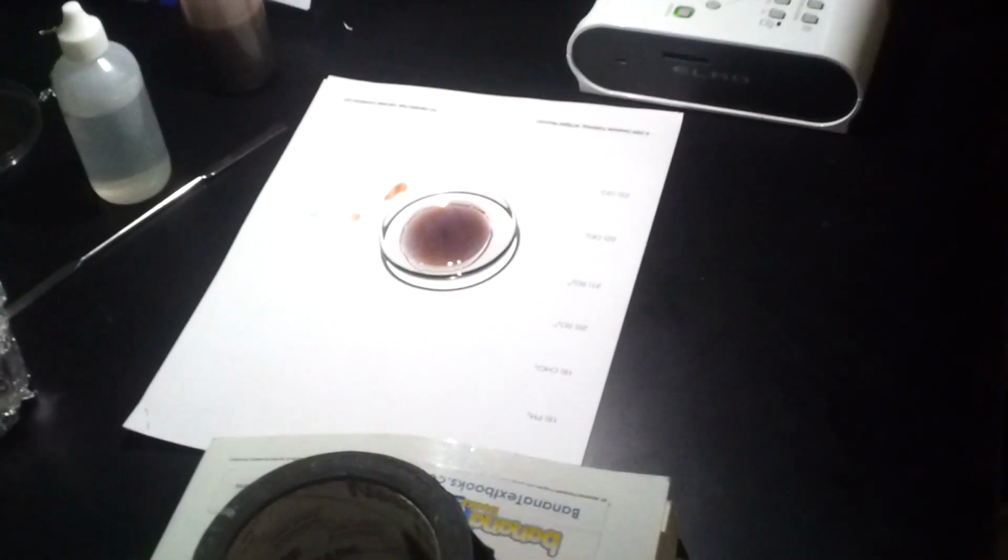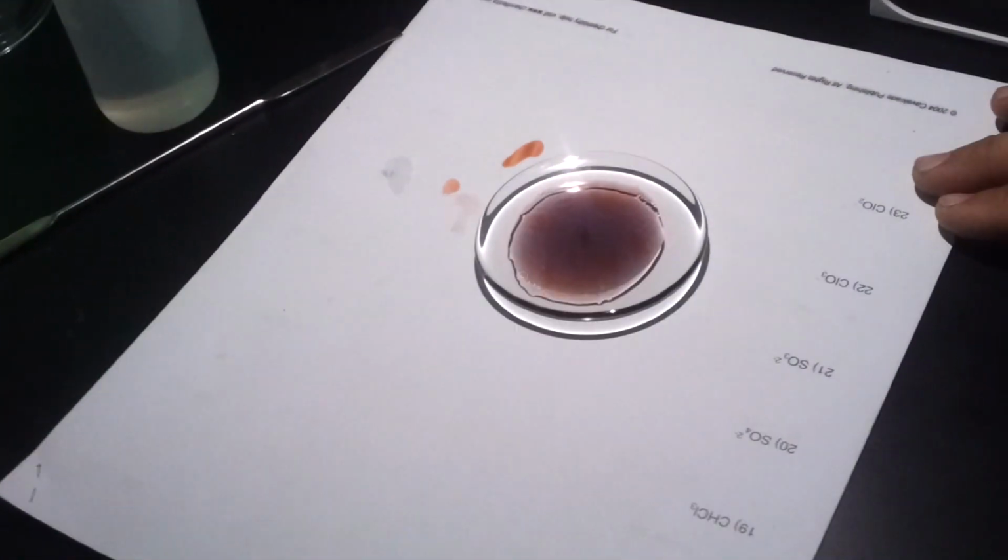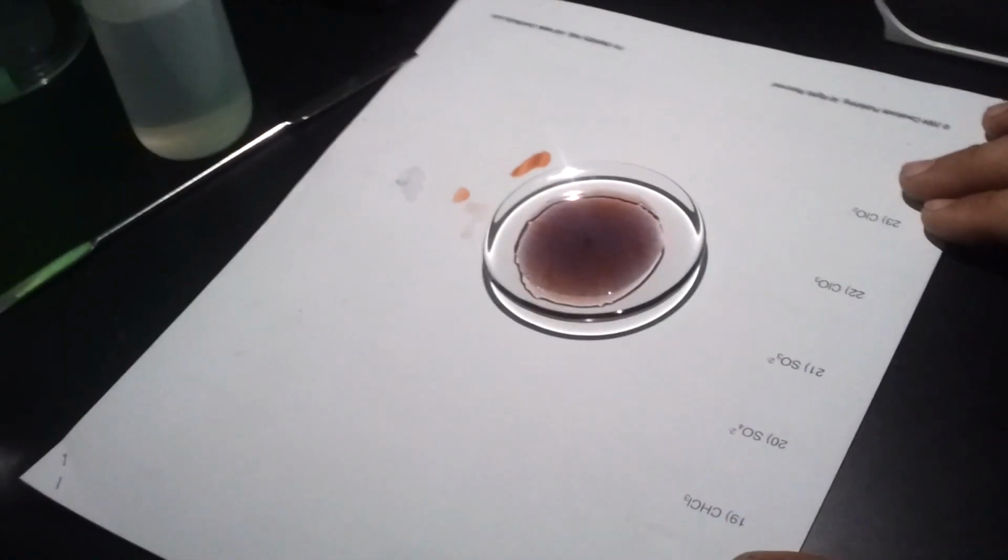You can zoom in and see it. It's hard to move it without disturbing it. Yeah, there, you can see it clearly now. You see it spreading? These are actually traveling waves. They bounce off of boundaries. They interfere with each other, just like all waves that you experience in any other situation.